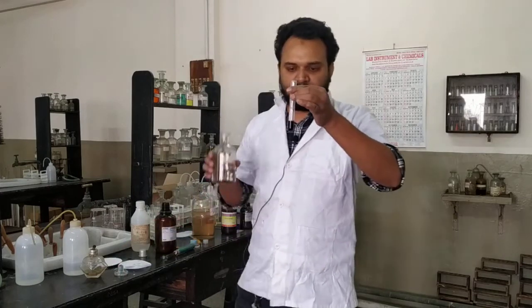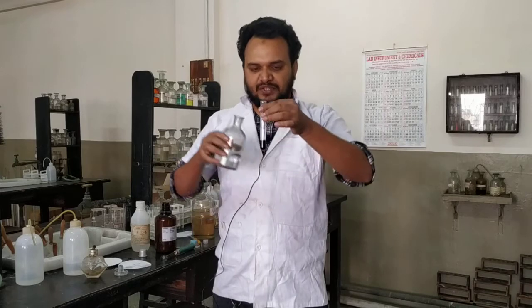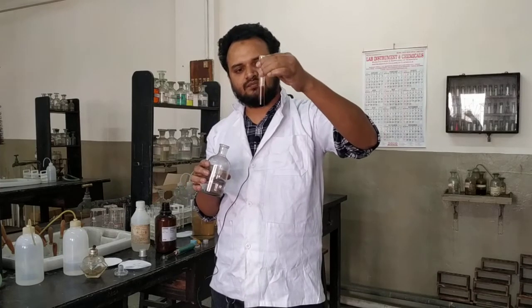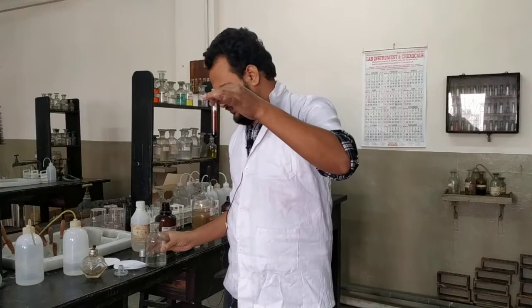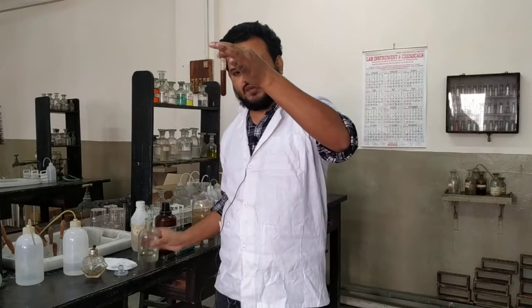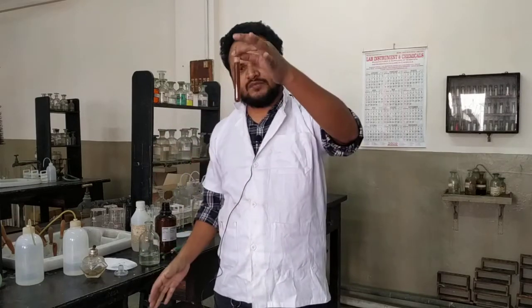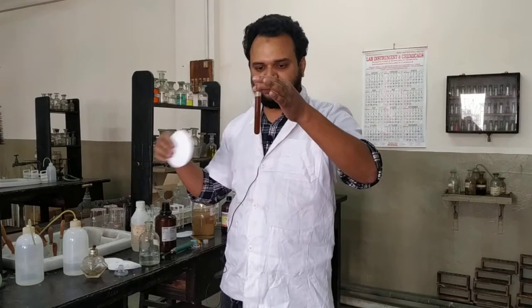Here is my ammonium hydroxide. You hardly need to keep it four to five minutes maximum — it will come to room temperature. Some more ammonium hydroxide will be required. Red coloration appears — this is your reddish coloration, not exactly red but a reddish type of color.